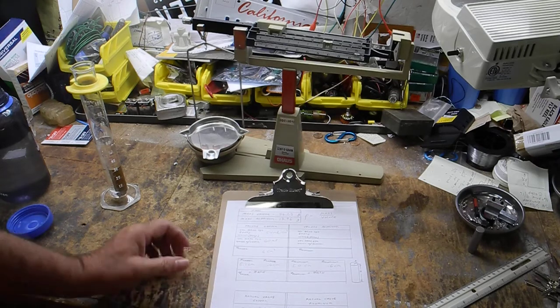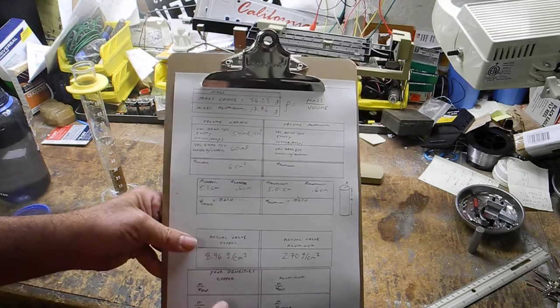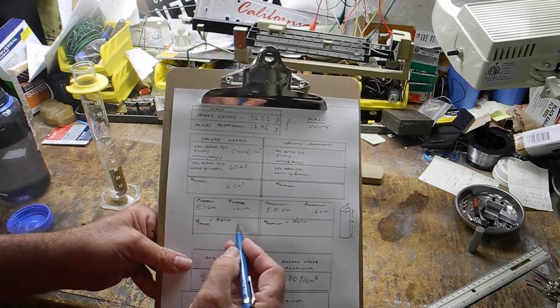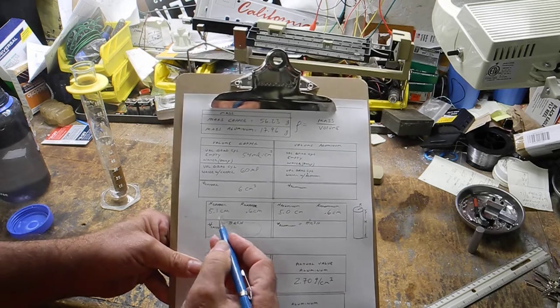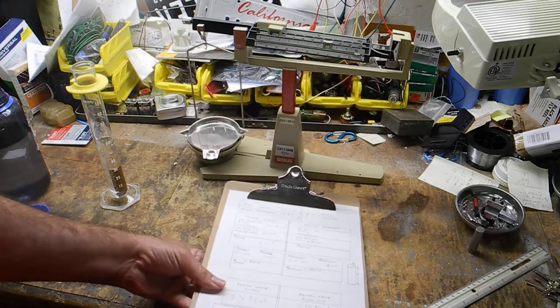So now you could do the density of copper two different ways. You could take your mass, which is 56.23, and divide by 6, right? That would give you your copper by displacement. Then you could take your mass, 56.23, and divide by the answer to this formula here. I'm not telling you that. That's what I want you to do. Show me you can square. Show me you could use pi. Show me you can multiply by height. Okay? All right, and let's do aluminum now.